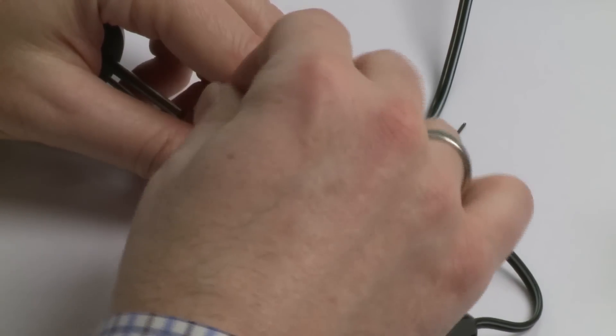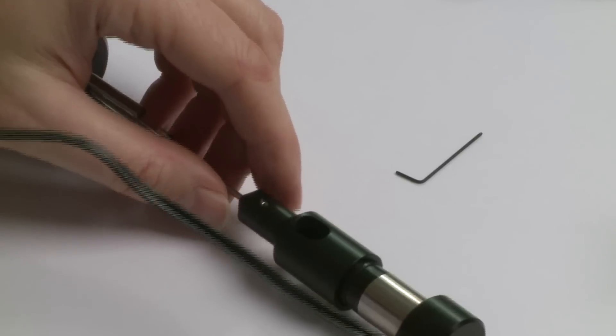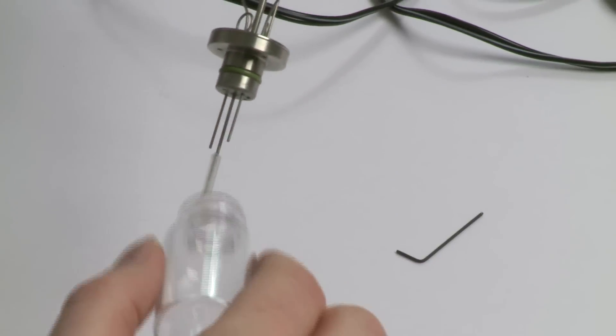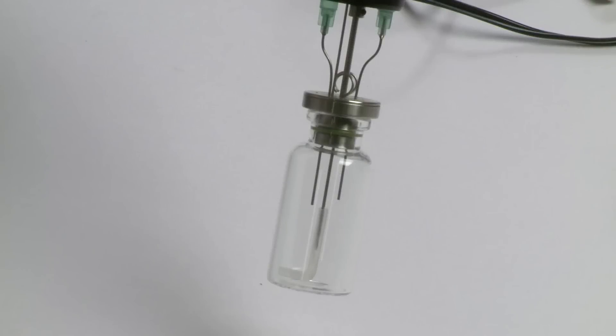Not too tight but good enough for testing. Then you remount your ampule and you want to make sure now it's much closer and just above the bottom.